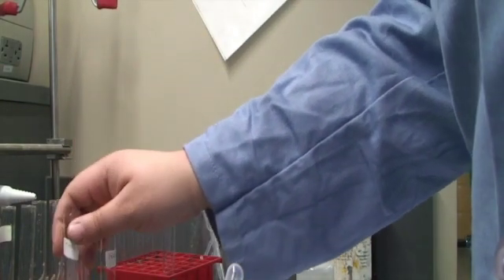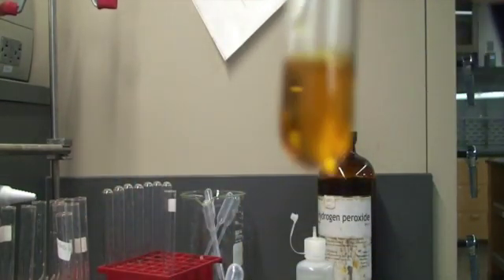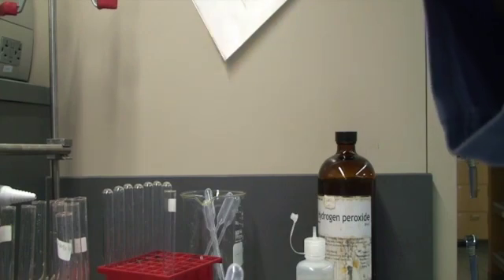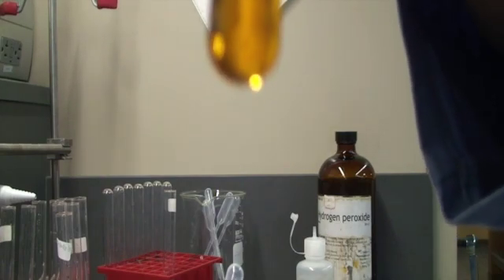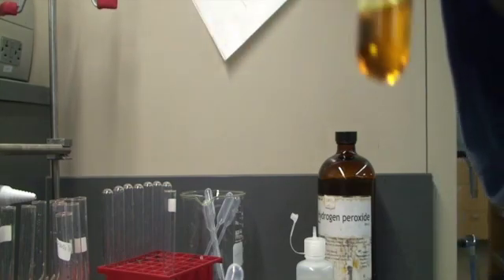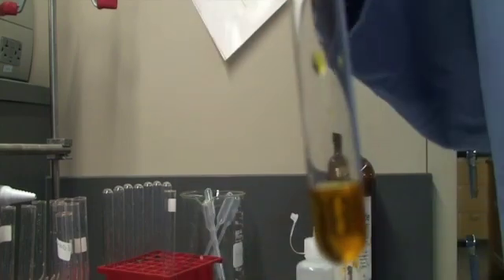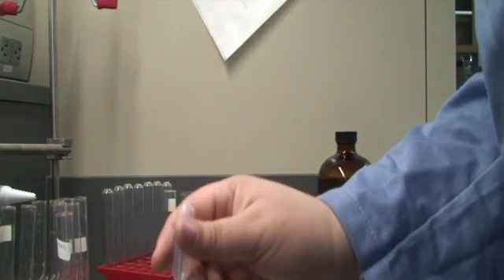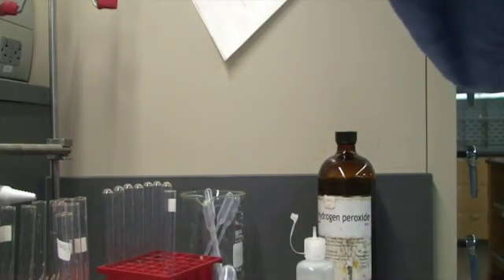Now we're going to take this iron(III) chloride — this is a non-acidified version with a very light yellow color. We are going to add 2 milliliters of peroxide to see what happens. It might be a little hard to see, but it is definitely bubbling — you can see a little bit on the top there.